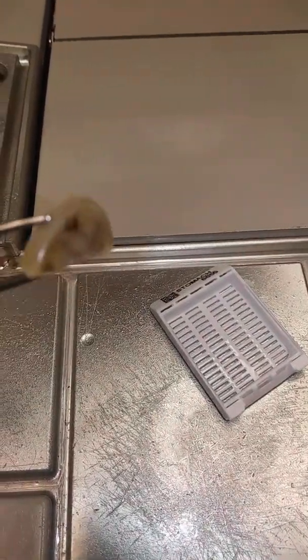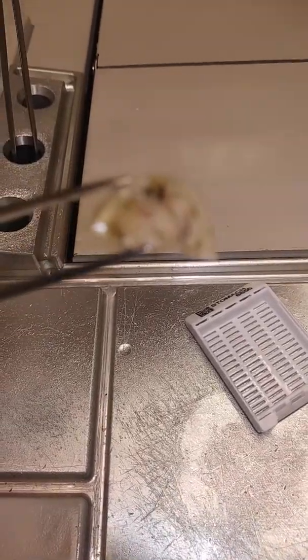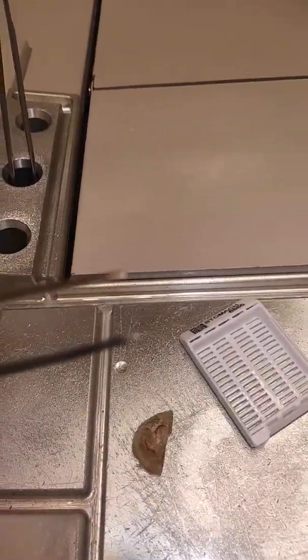This is the piece of stomach after processing.